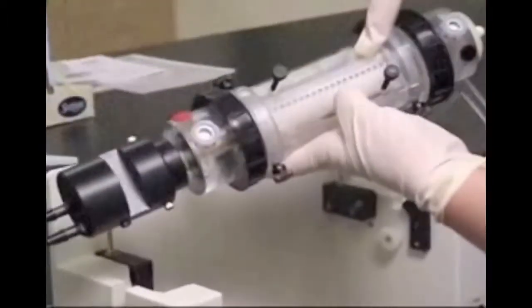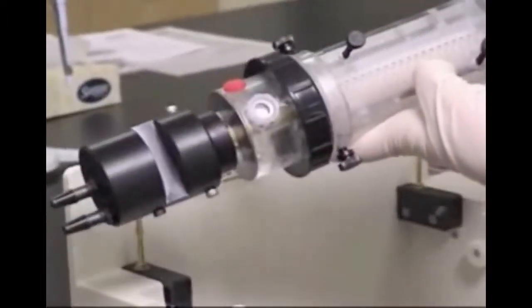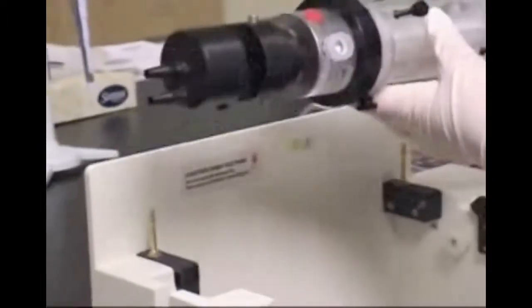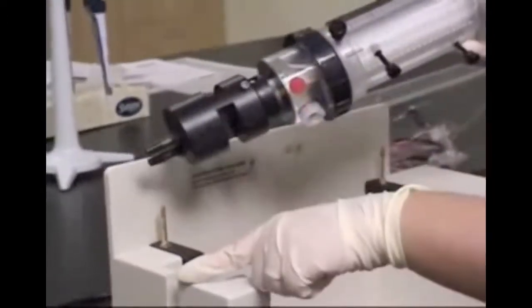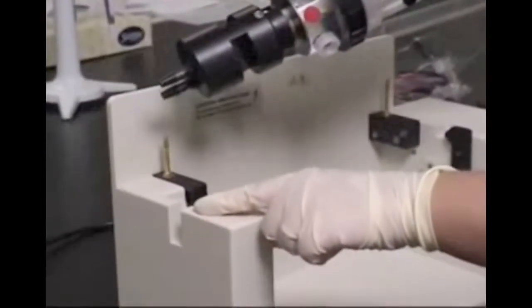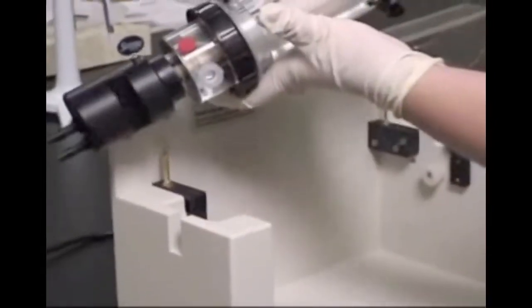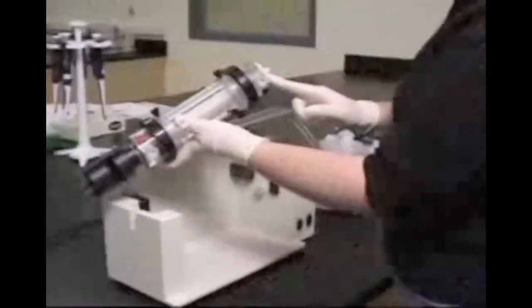The base of the cooling finger contains two notches that line up with a notch in the chassis. On the cathode chamber, there is a gear mechanism that should meet up with the gear on the chassis as well.